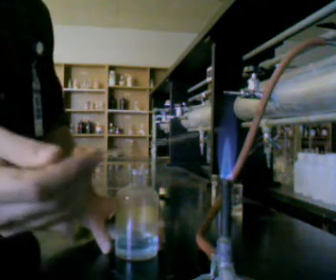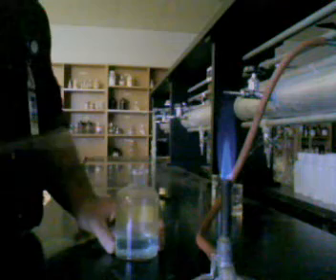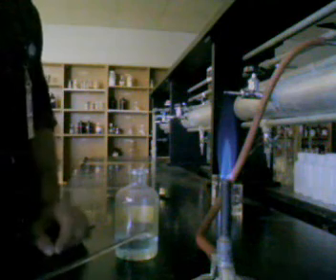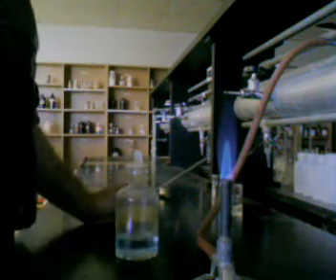that flame. Now notice, since I'm using a glass stirring rod here, if I heat that up, I get that bright sodium flame. So what you're looking for, as I just showed you in this example, was that initial burst of color, little flashes of green. That's what you should look for. So this concludes our flame emission test demonstration.